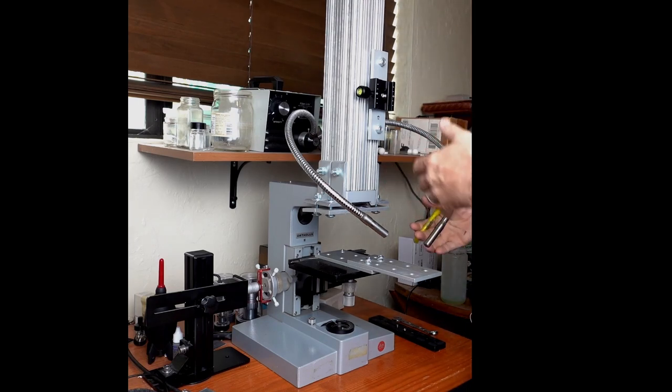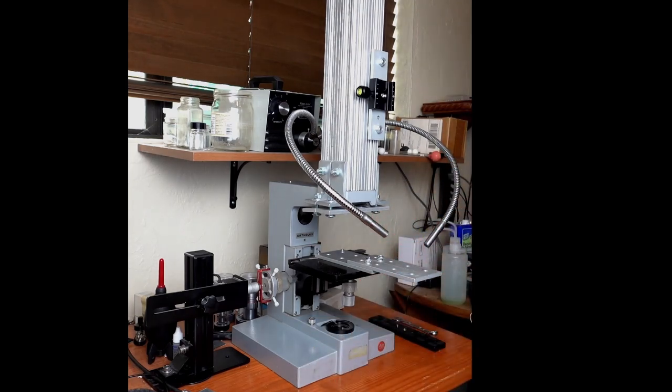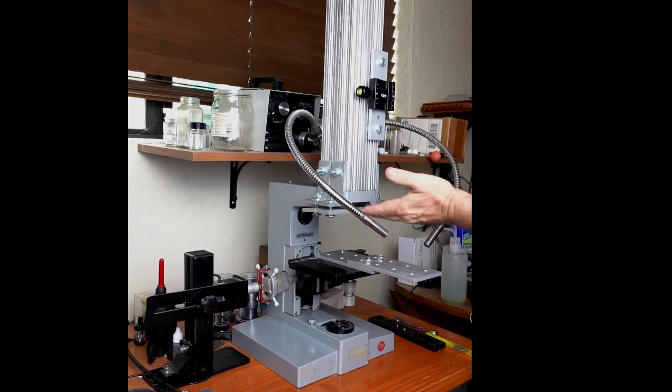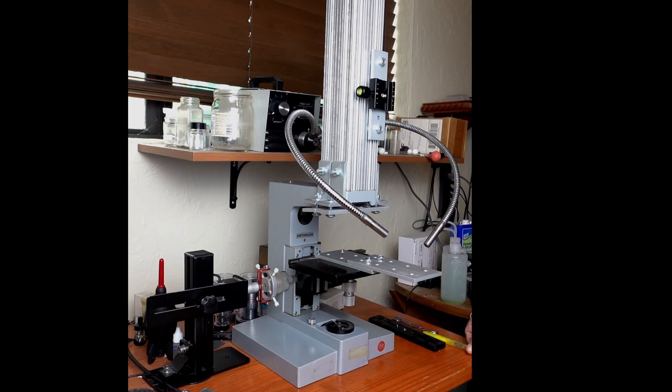It works pretty well. Because it's clamped, I can take it off and use, if I ever want to do anything else with this rig, I can do that. I haven't cut it off. I haven't stopped myself from using it for anything else. I still have the dovetail for the objectives. I have an epi light feed and a transmissive light feed, so you can make a fully operational microscope out of it.